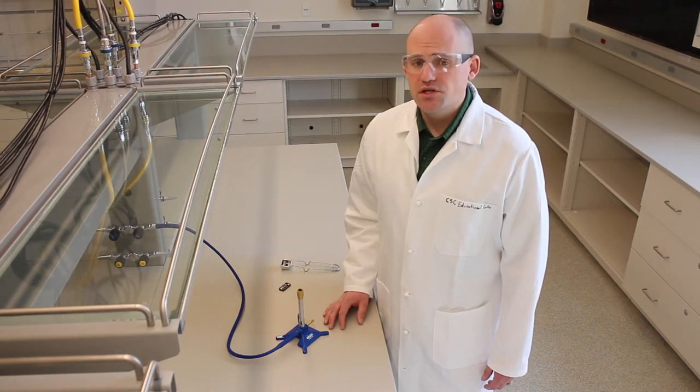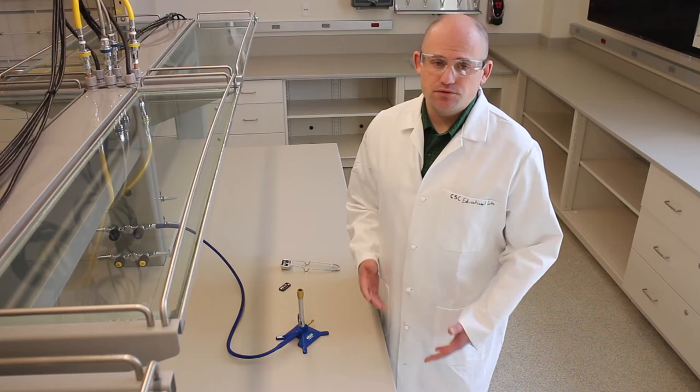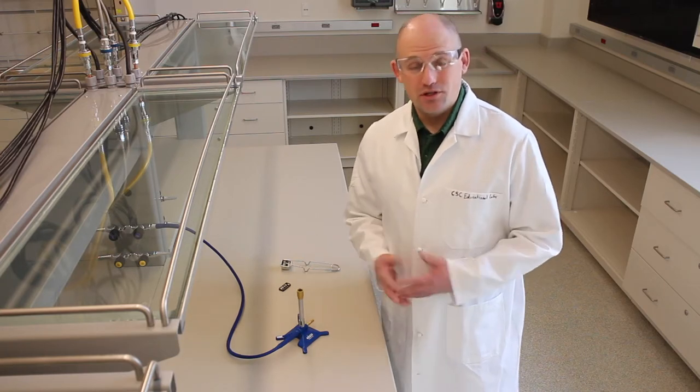The first thing to think about when using a Bunsen burner is that you're working with an open flame. So before starting to work with one of these burners, tie back any long hair, or you'll wind up looking like me.